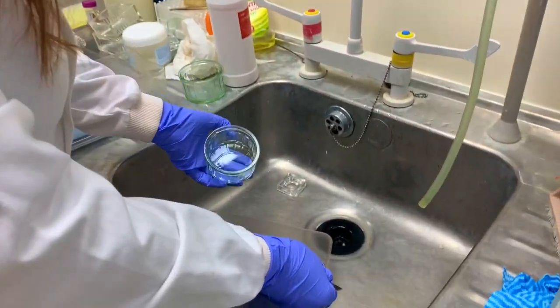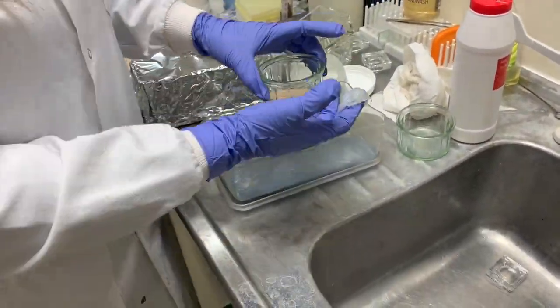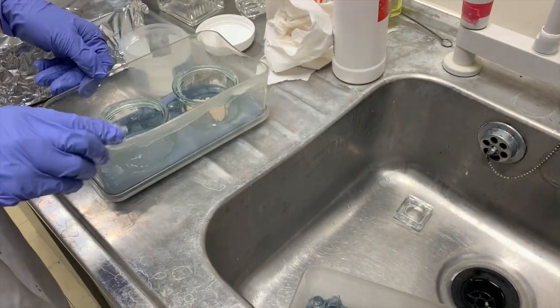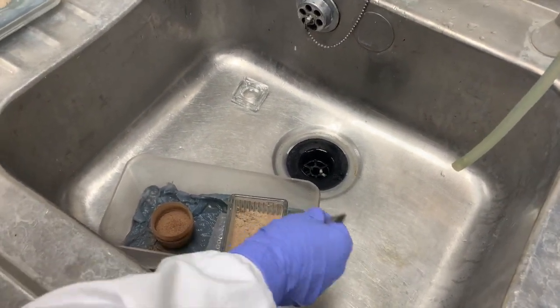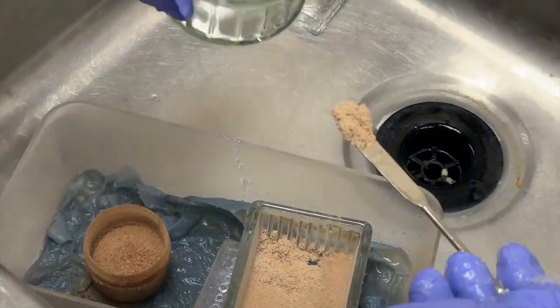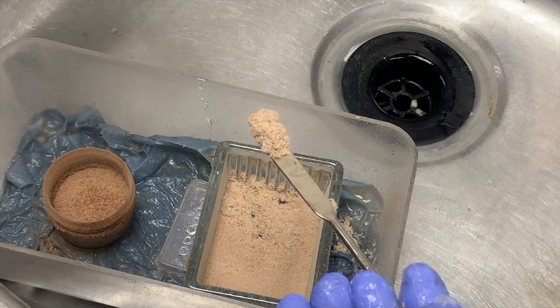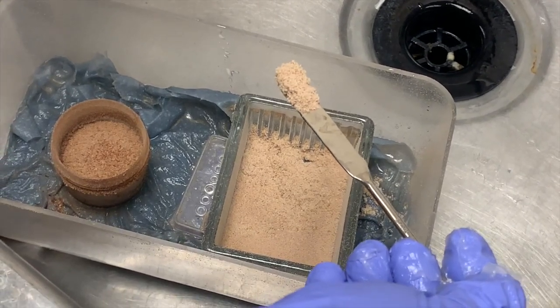So I'm just going to get a few mites. So you're going to basically split this colony in half into two. Yeah, and then I'm just going to put the rest in the freezer at minus 20 degrees. Look, they're just moving — they're moving off! Wow, that is amazing. That's literally them just walking off.